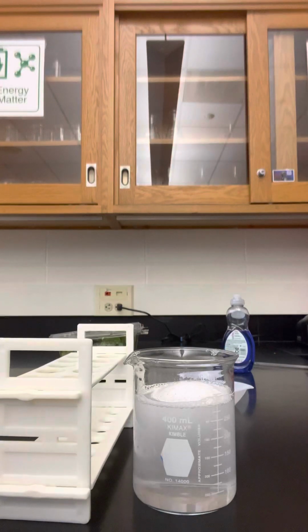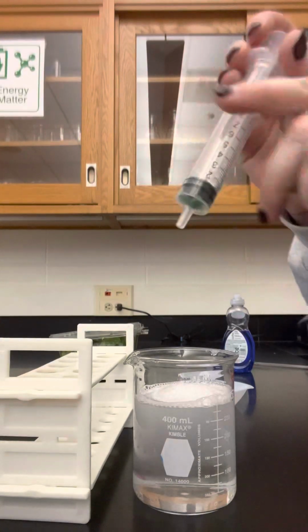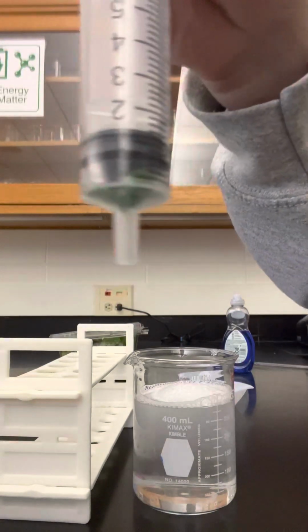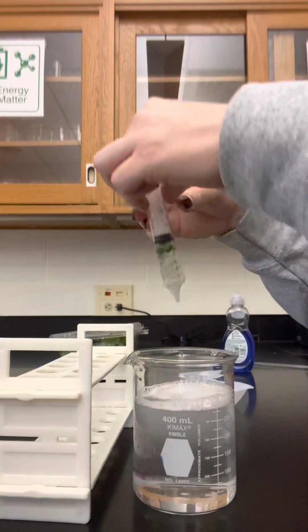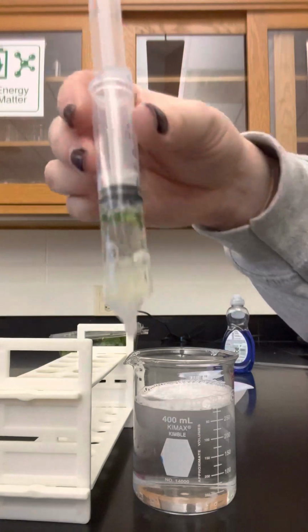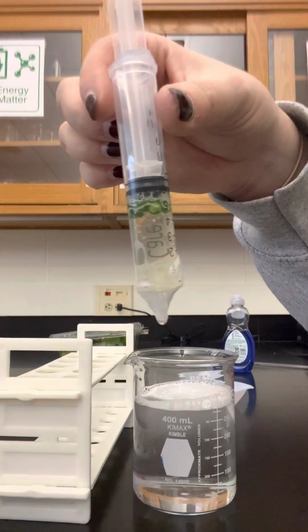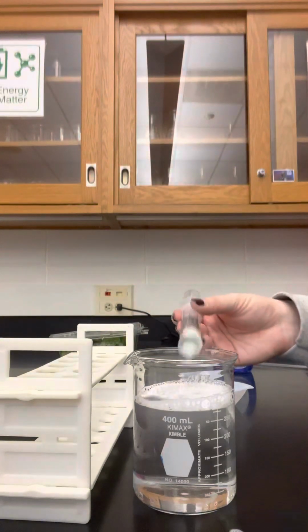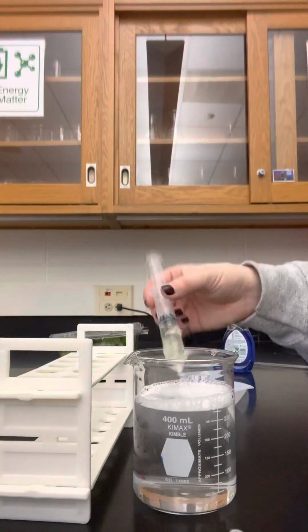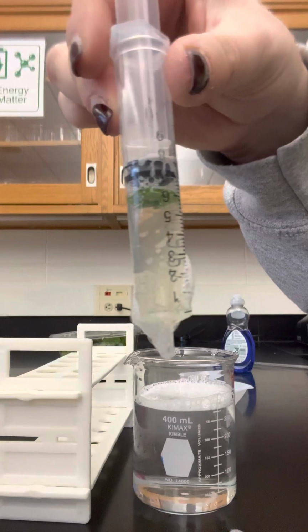But first, we need to make sure that we get this normal solution into our syringe. So we're going to push the plunger back in all the way. Don't press on the discs, leave just a little bit of room. And then you're going to suck up about enough liquid to fill like 1/3 of the syringe. Again, it does not need to be exact. I'm actually going to do a little bit more. Okay, so that's about half actually.